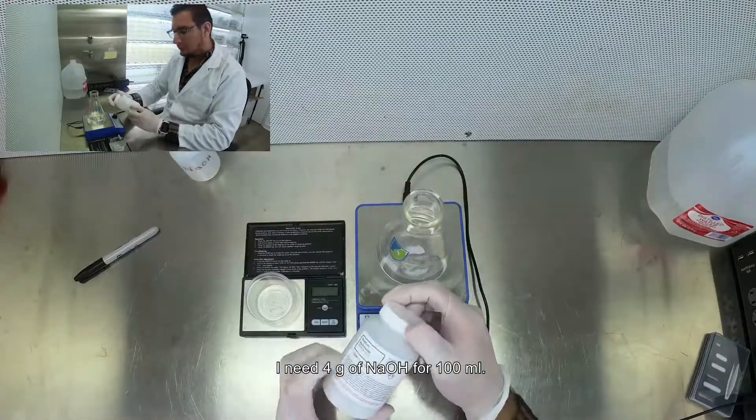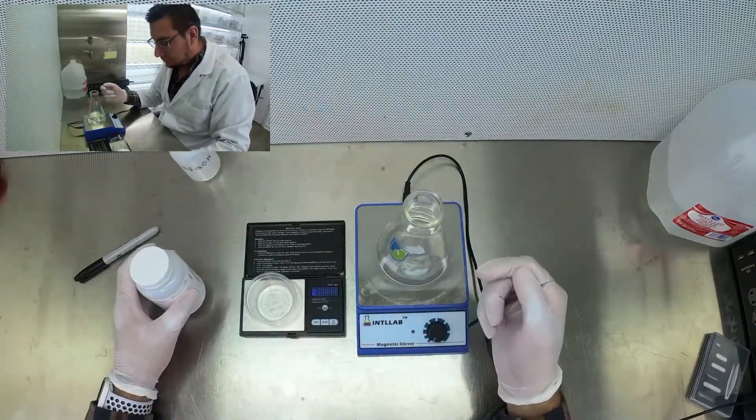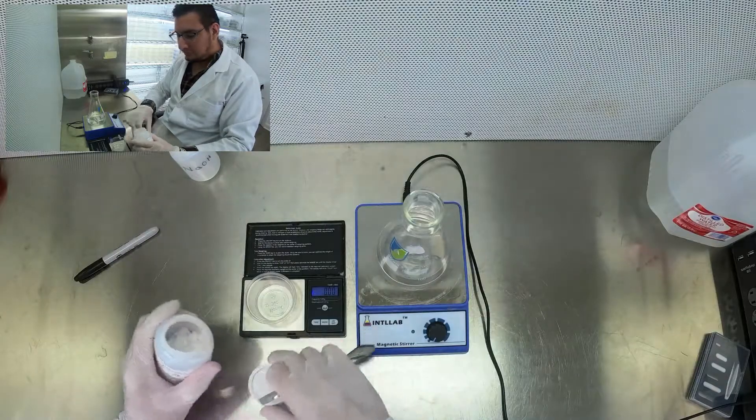I need 4 grams of sodium hydroxide for 100 ml.